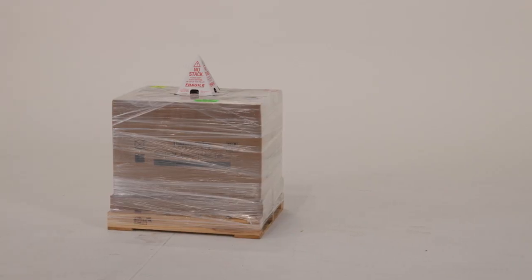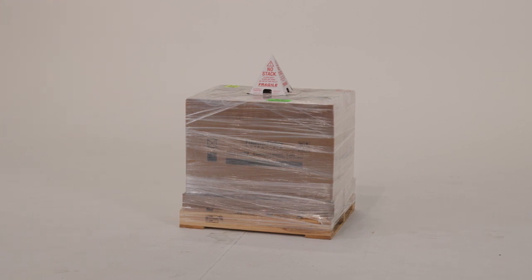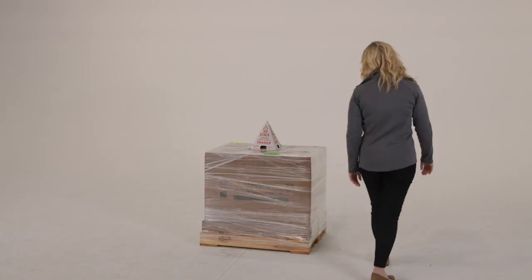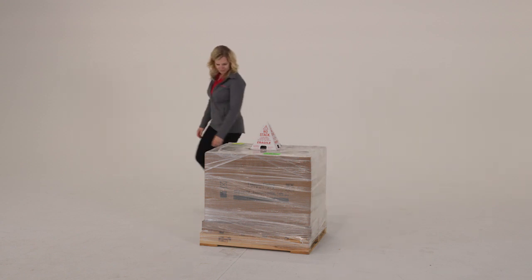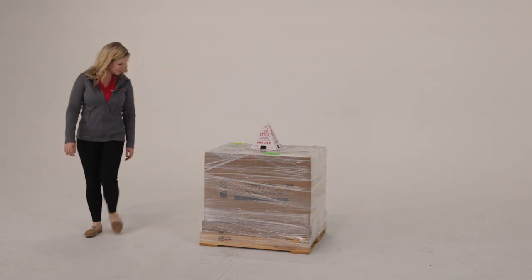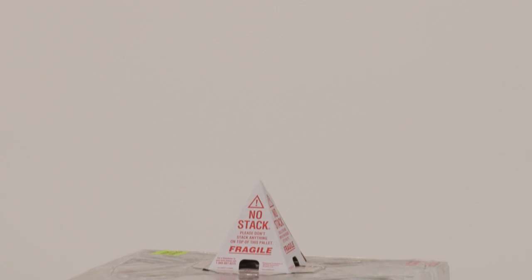When the Solaris temperature-controlled benchtop shaker arrives at your facility, take a few moments to inspect the packaging. If you notice any damage, please make a note of that on the shipper's packaging list or receipt.